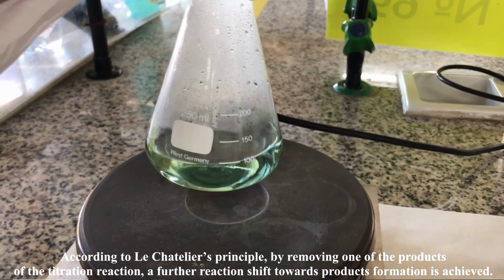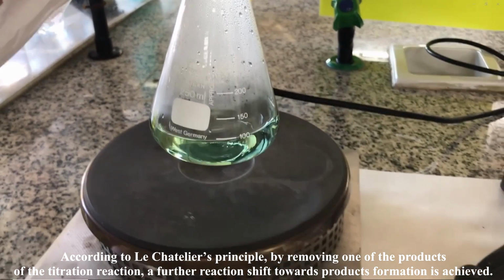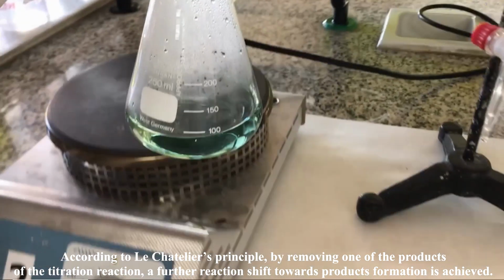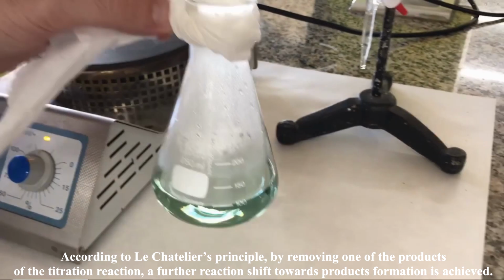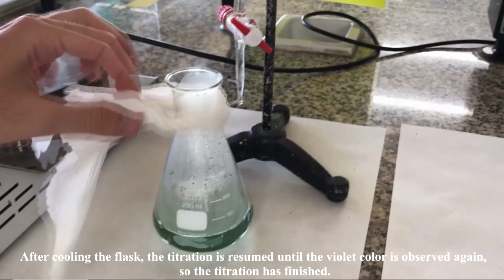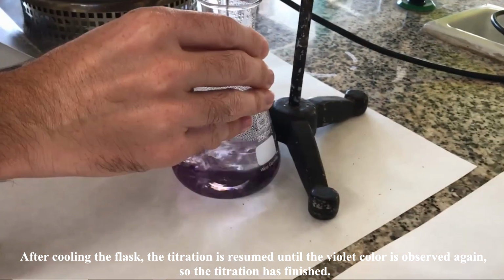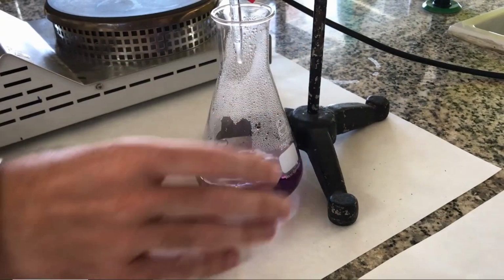According to Le Chatelier's principle, by removing one of the products of the titration reaction, a further reaction shift towards products formation is achieved. After cooling the flask, the titration is resumed until the violet color is observed again, so the titration has finished.